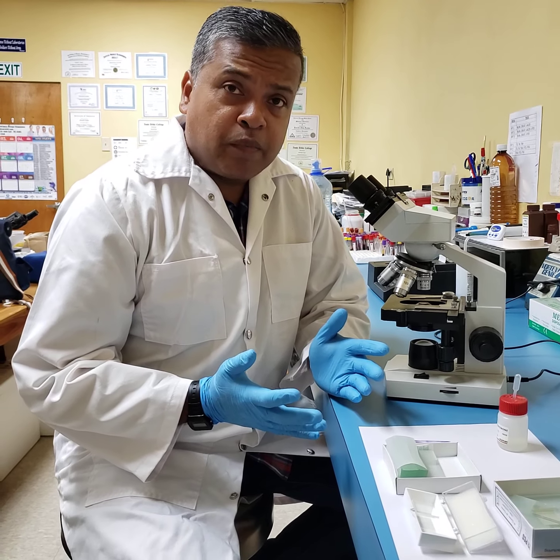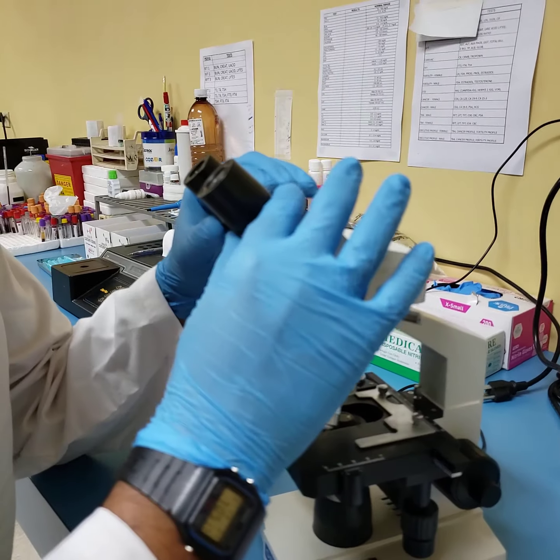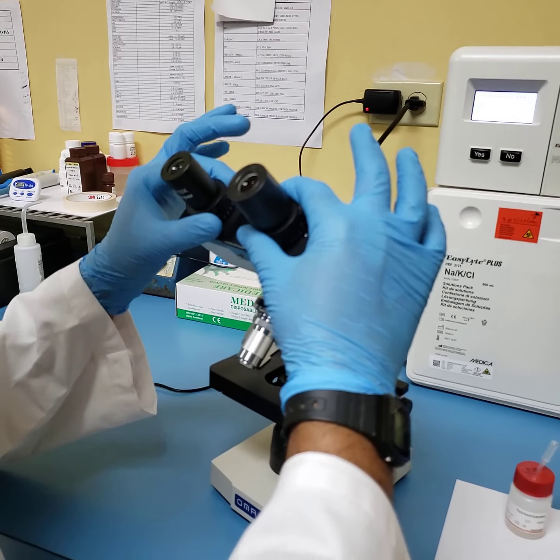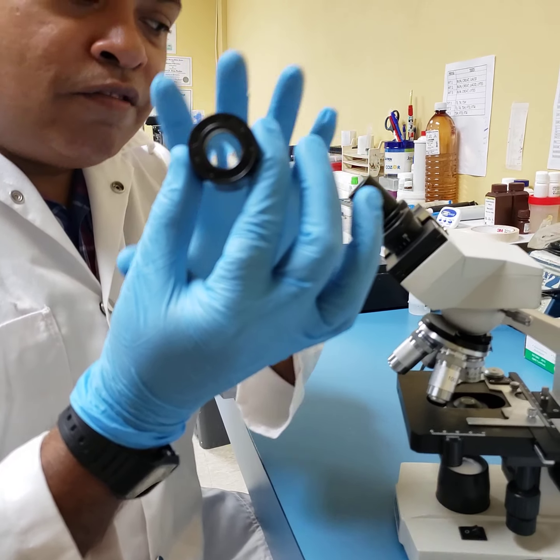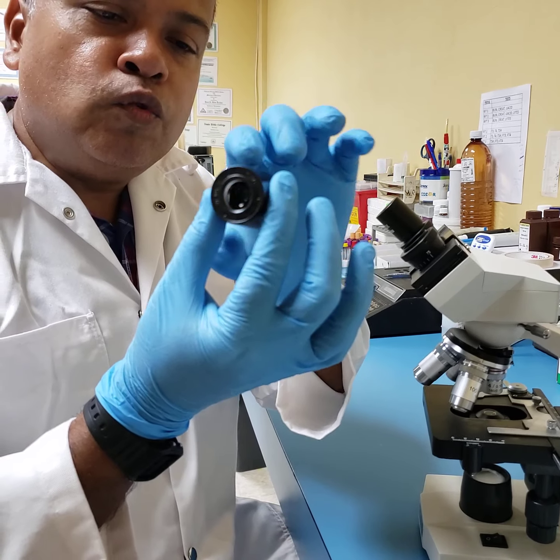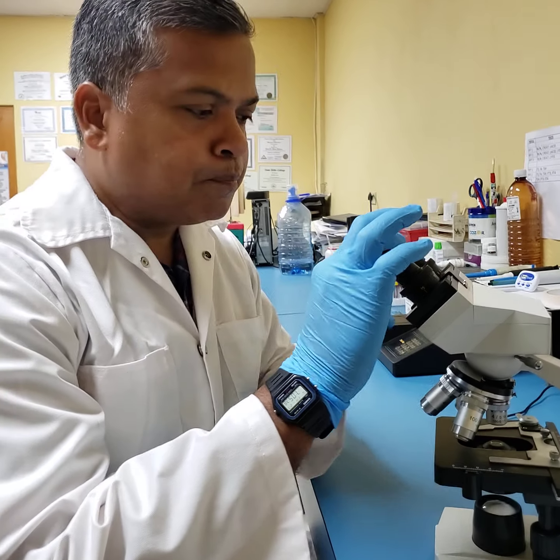There are many different types of microscopes, but this one is called a binocular light microscope. Binocular meaning there are two eyepieces. As you can see here, the eyepieces are adjustable. The eyepieces also come with a magnification of 10. So even before we attempt to magnify an image, anything that is viewed with this eyepiece is magnified by a power of 10. So that's one of the first things.